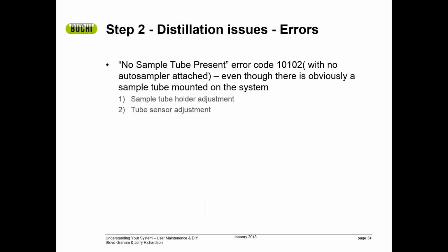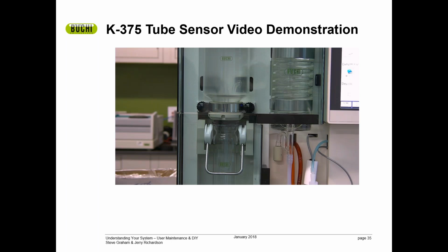Okay, a very common error that we receive a lot of calls about is no sample tube present, both on the K360 and the K375. You can see that the sample tube is on the system and latched into the system, but you get a no sample tube present error. This is quite common. What has happened is the adjustment of the sample tube in relationship to the sensor has moved somewhat, and it's a very simple process on the K375 to adjust this so that it takes care of the problem. We're going to take a look at a video where we adjust that sample tube sensor to remedy this.